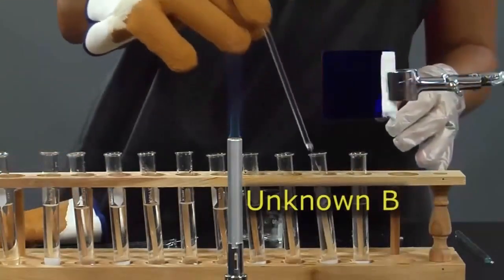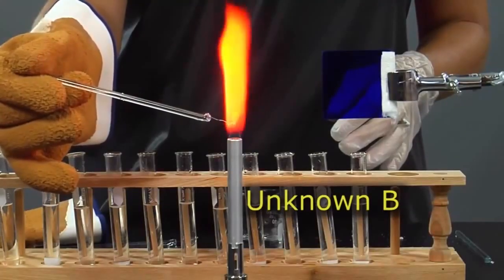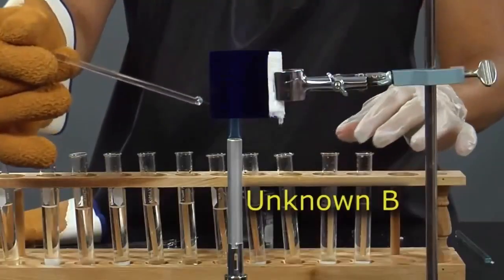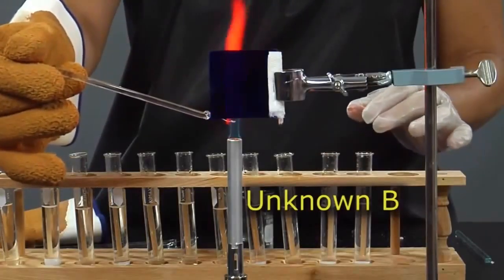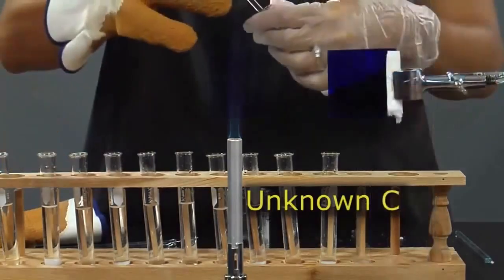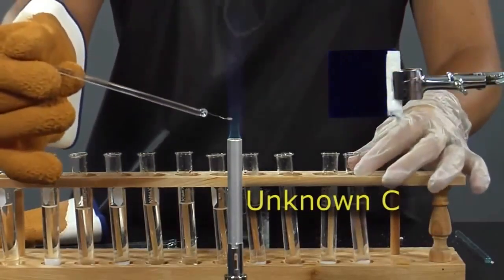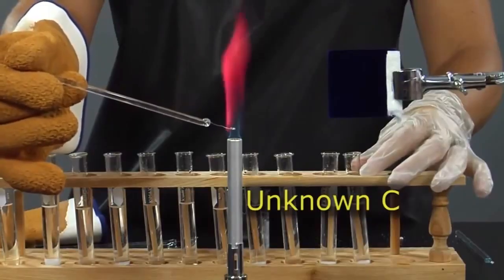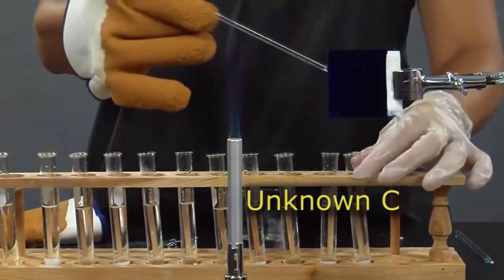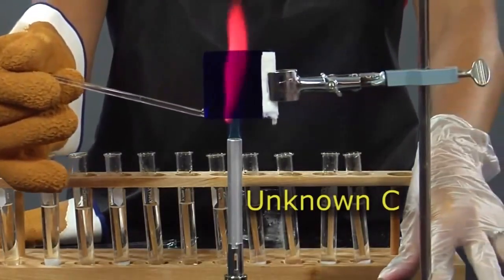Next, unknown substance B. Enter the color. Finally, unknown substance C. Enter the color.